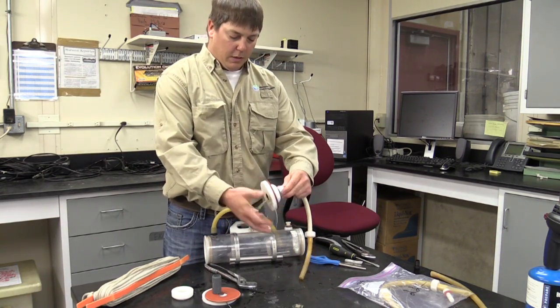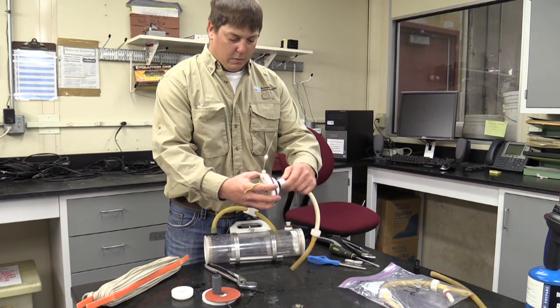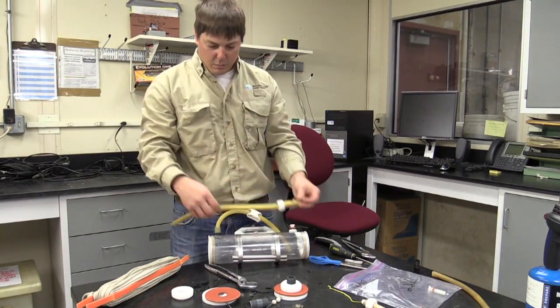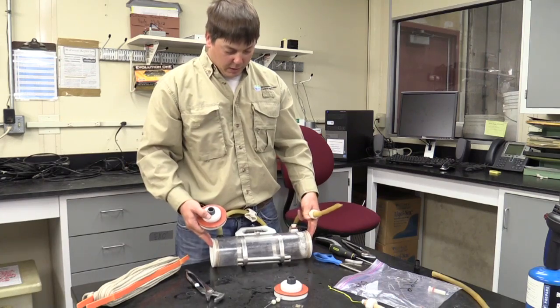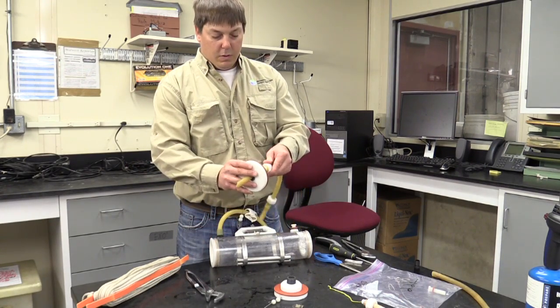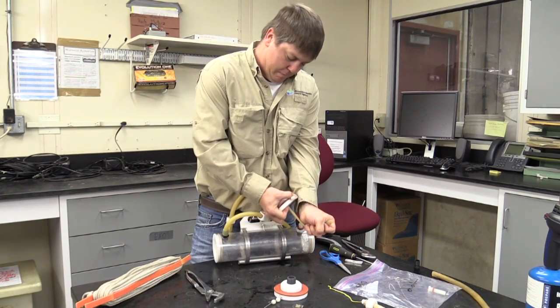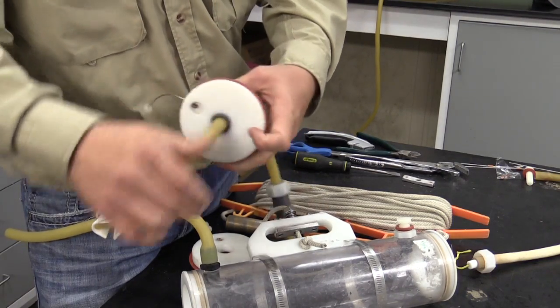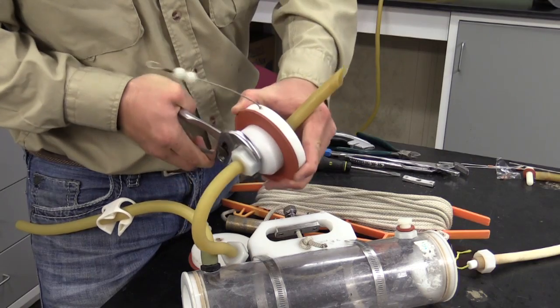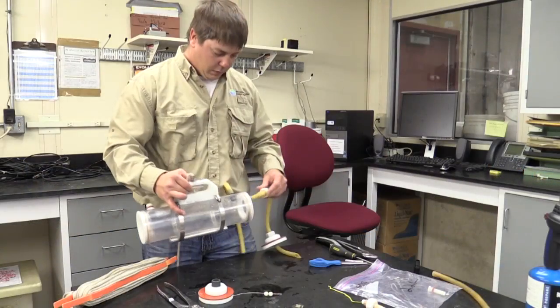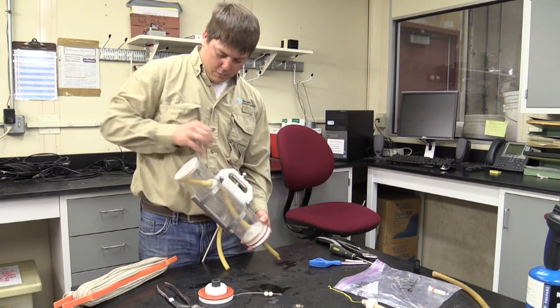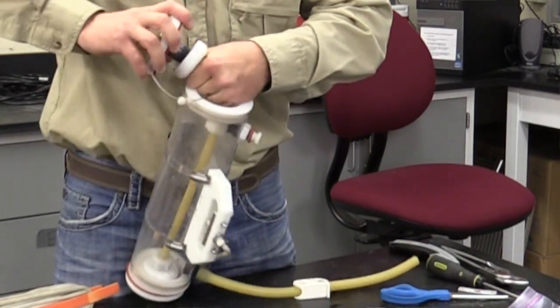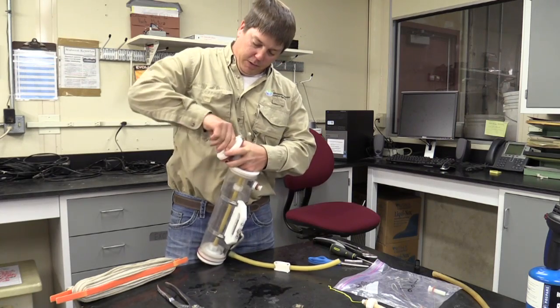Just unscrew it. And the same thing with the other side. This one was actually just finger tight here. This one came out. Otherwise, it comes with the new ones. I like to when I get this ready to put back in the Van Dorn and just reassemble it, I do one side first. You want to get this little plug that's inside the rubber pushed up inside this coupler here, at least enough until you get the threads on for the nut.